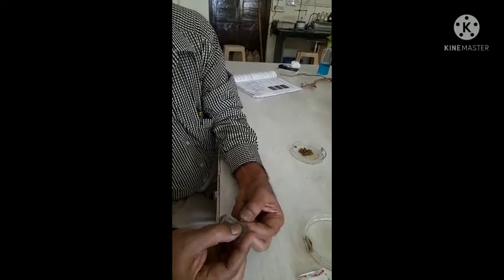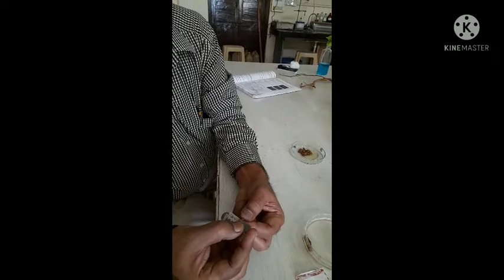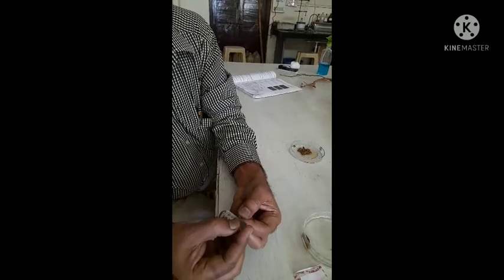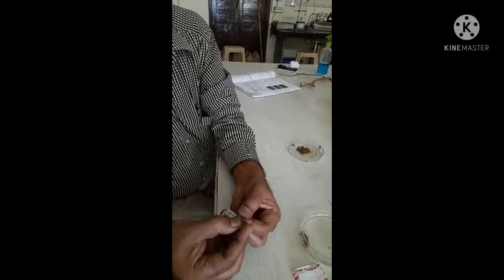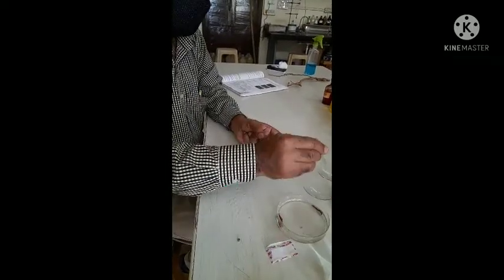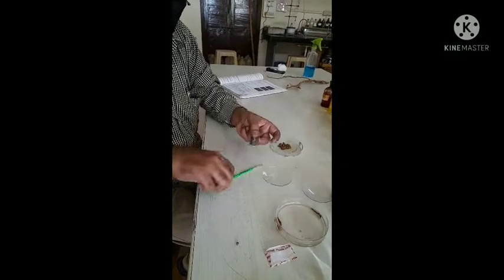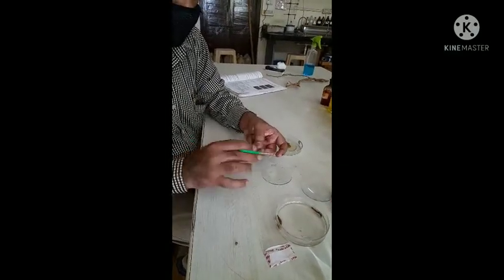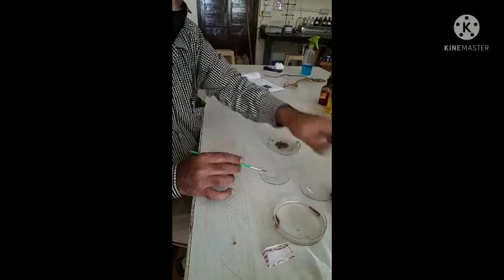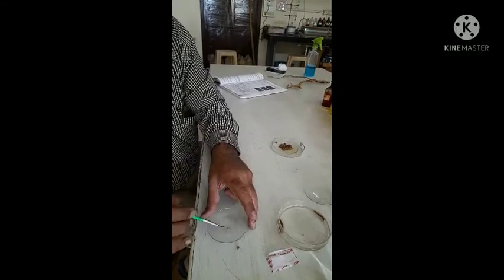Take precautions while taking the section; otherwise, damage or injury may occur to the fingers. Transfer the thin transparent sections with the help of a camel hairbrush into a watch glass containing water. We are directly taking water in a watch glass and transferring the sections with the help of a camel hairbrush.